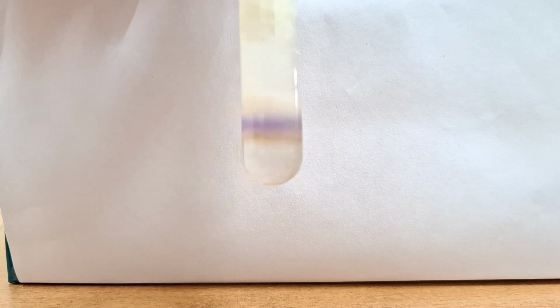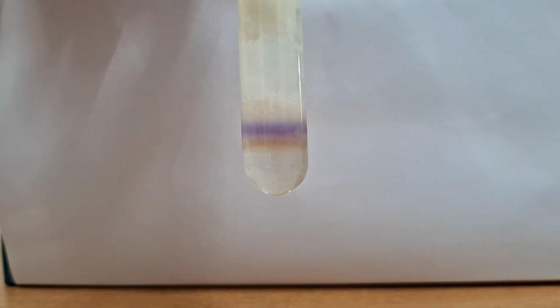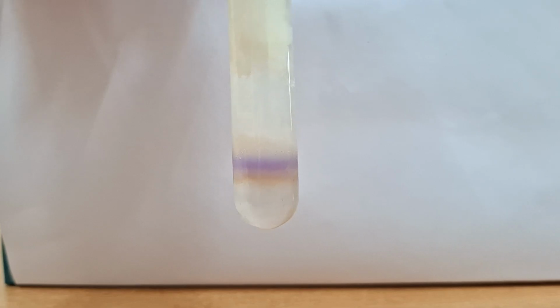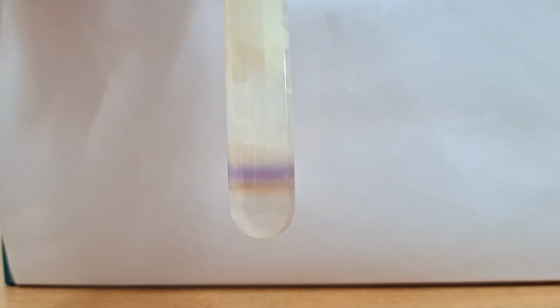So next, in continuation, we have this test which is called the aldehyde test. Hope you can see the aldehyde test. For this test you take 2 ml of protein solution. To it you add 2 to 3 drops of diluted formalin, and on top of it you add 1 ml of mercuric sulfate, and then mix it well.